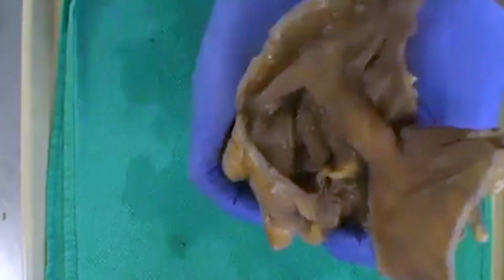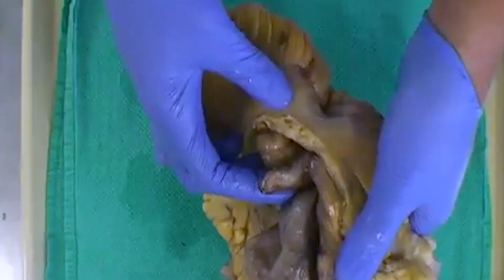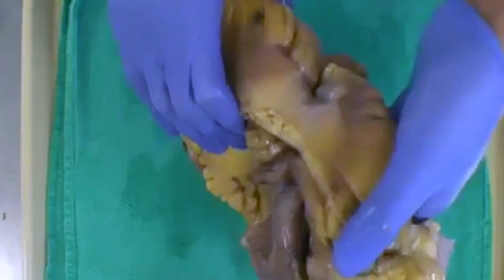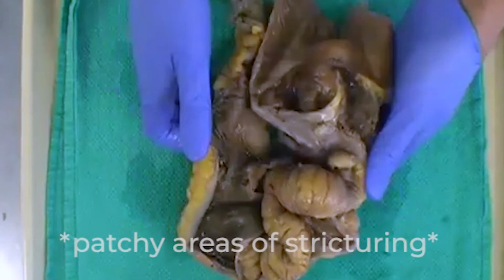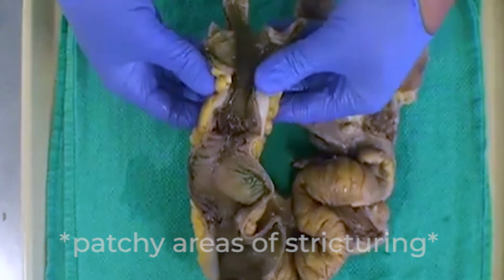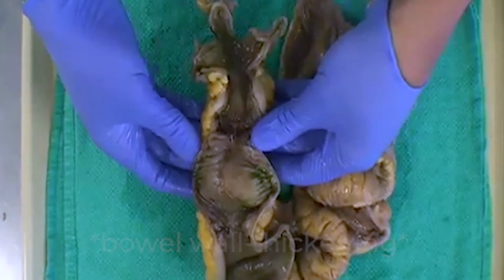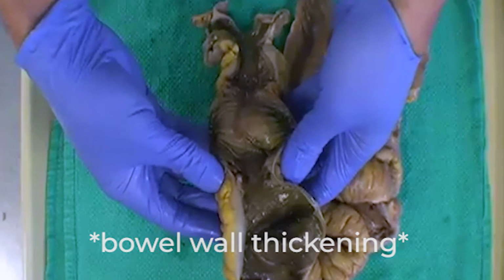And on the flip side, we see a very dilated appendix, sort of sitting in behind here. So that is an IC resection, and what we can see is mostly in the small bowel, we have areas of stricture and thickening of the bowel, basically the entire layers, all three layers of it.